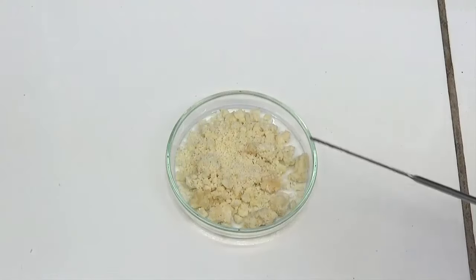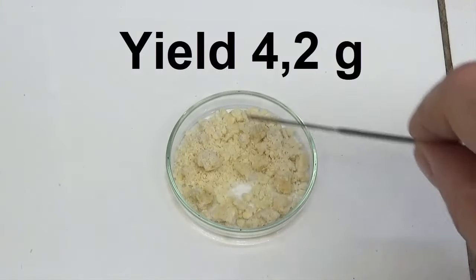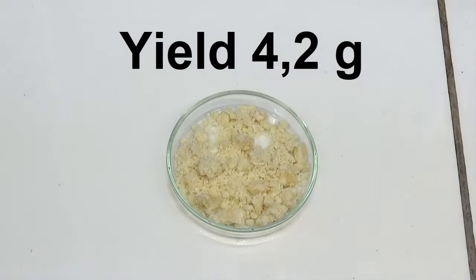The residue obtained is dried in an oven at 50 degrees. The yield was 4.2 grams of amygdalin.